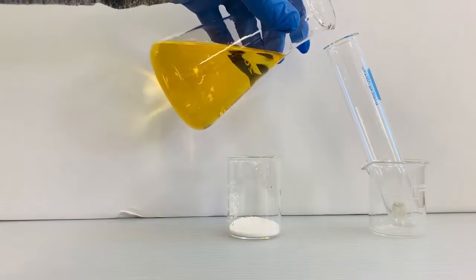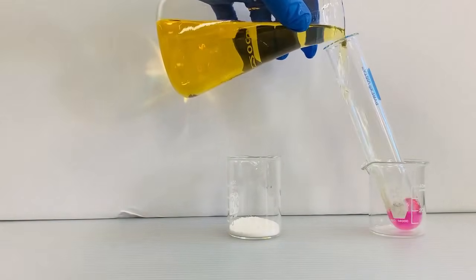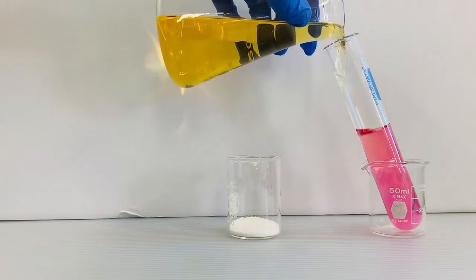Check out this cool experiment. When this yellow fluid is poured into the test tube, the fluid turns red.